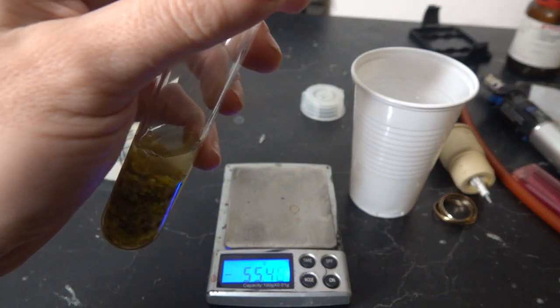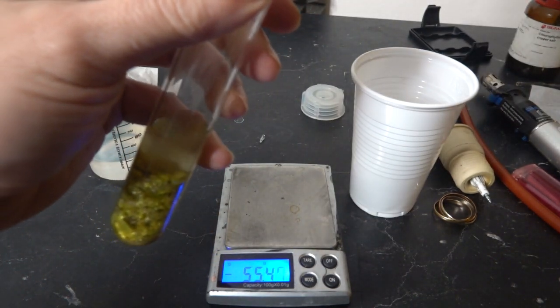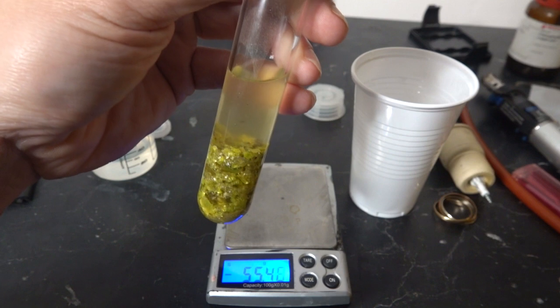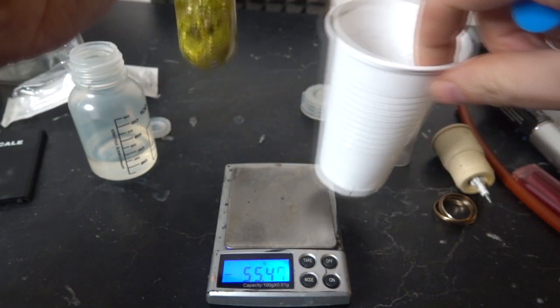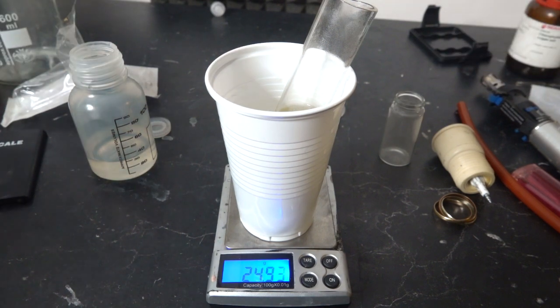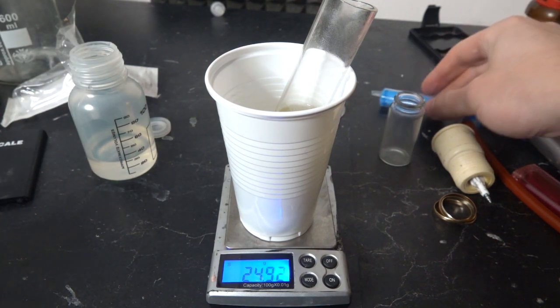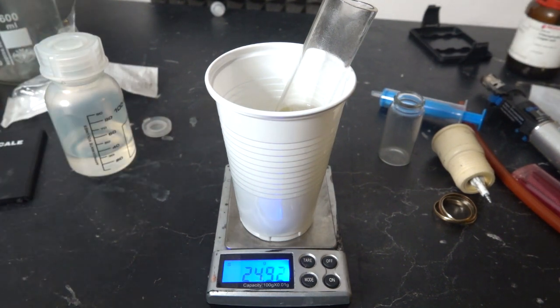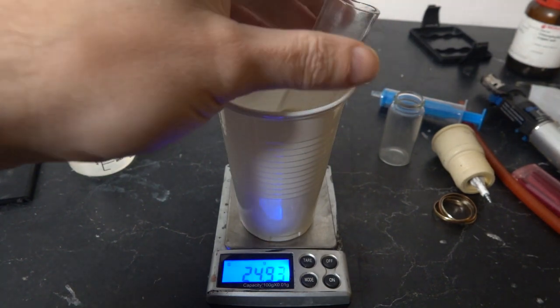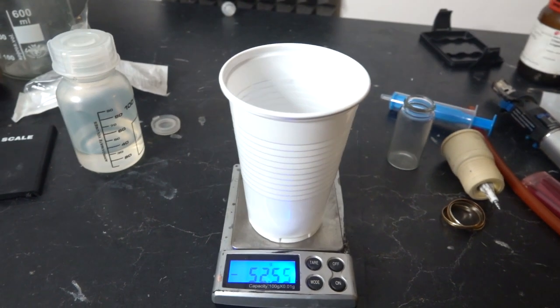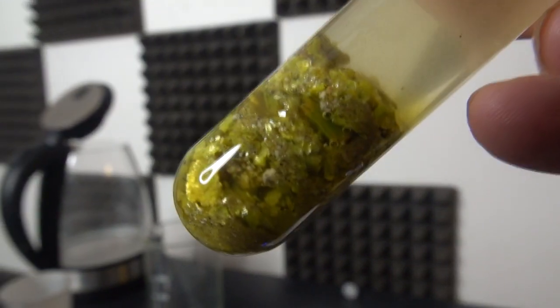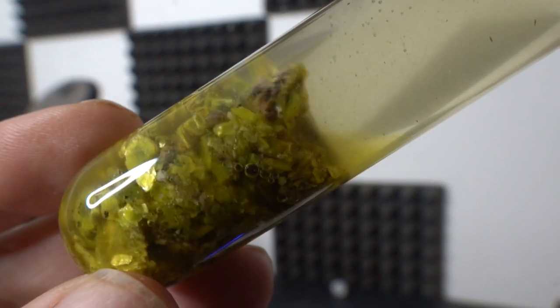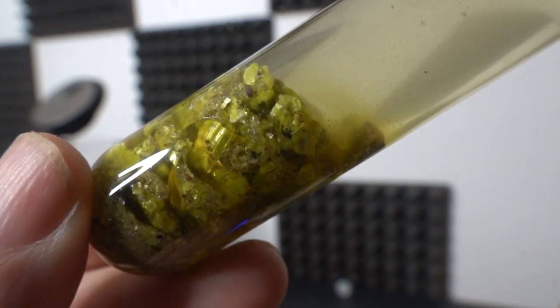Oh hey, the crystals are beautiful now. I've got to zoom in on those crystals. They're dissolving already, but they just look so beautiful. Okay, so I'm gonna wash that up because this stuff is beautiful and that's 24 grams. Good, let's zoom in on this because this is now absolutely gorgeous now that it's dissolving. That's concentrated, 70% by weight nitric acid there.